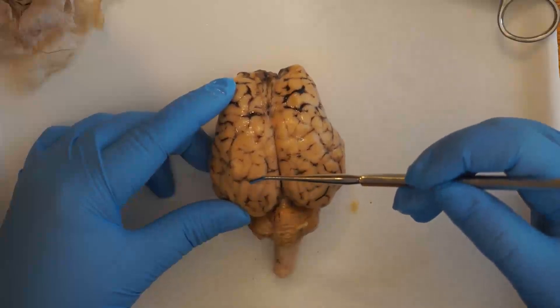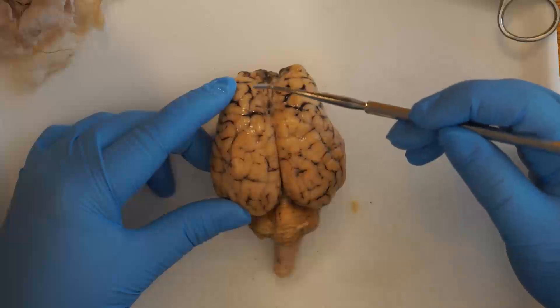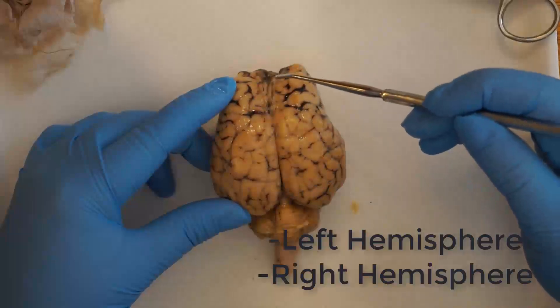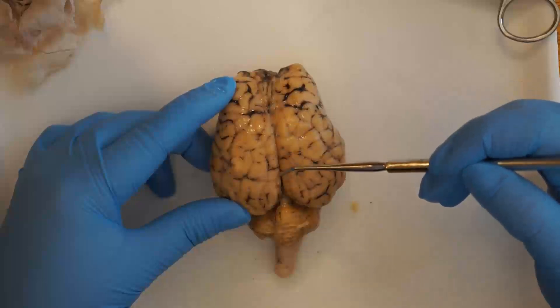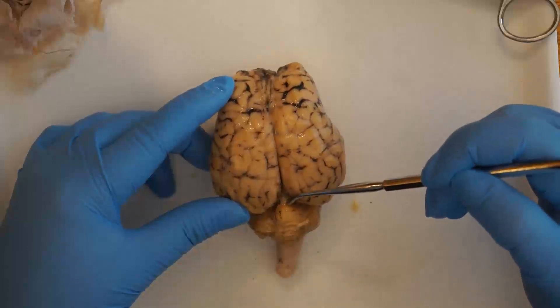The cerebrum is divided into the left hemisphere and the right hemisphere, and the division is made by that longitudinal fissure down the middle.